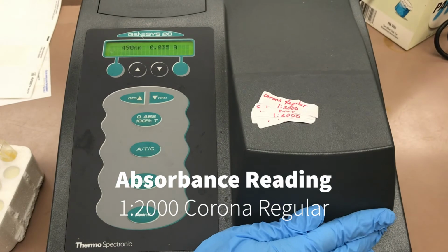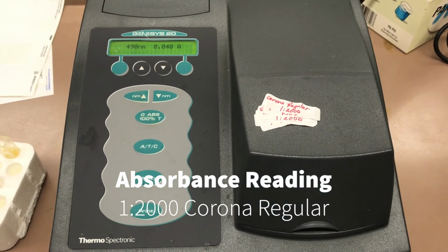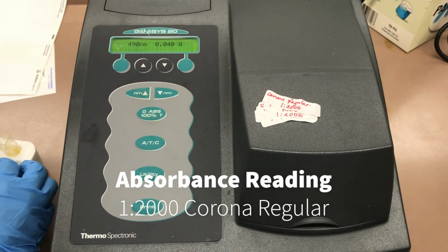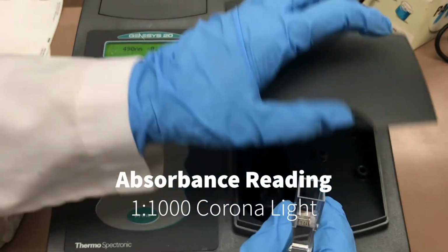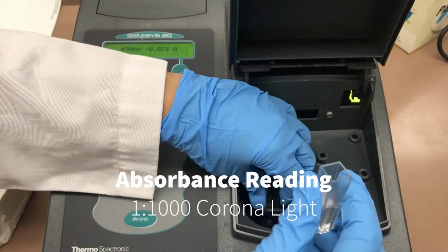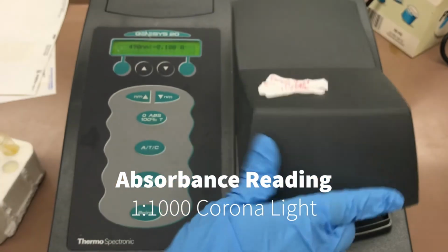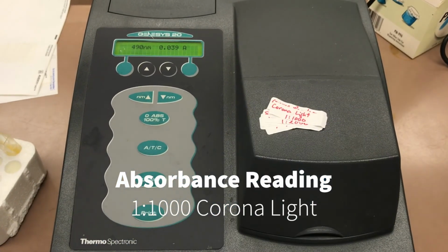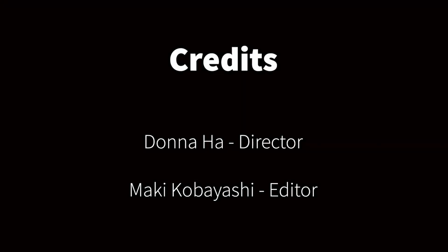This is the absorbance reading for Corona regular. This is the absorbance reading for Corona Light. This concludes the Total Carbohydrate Lab.